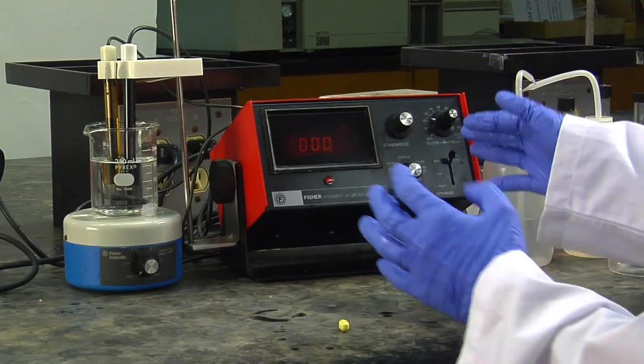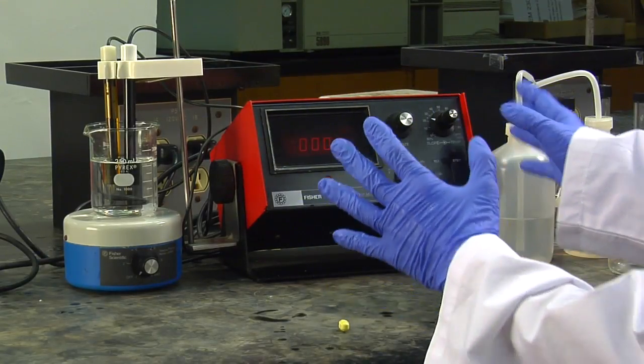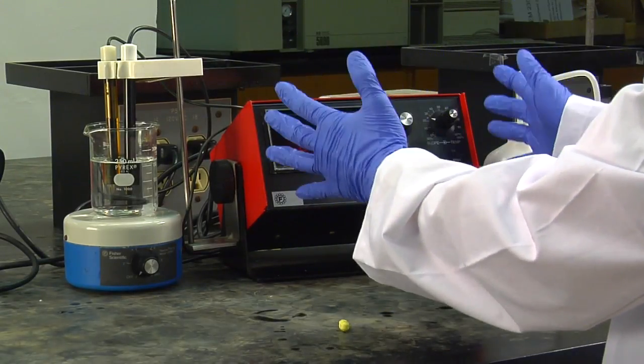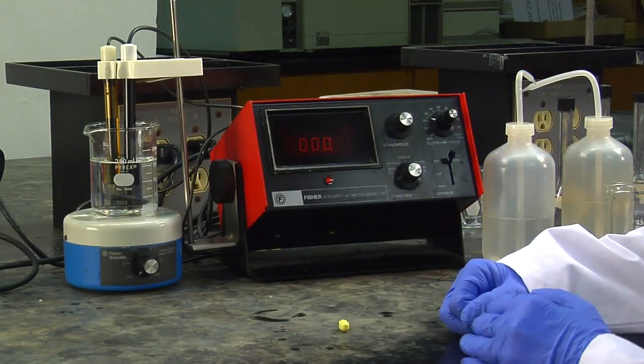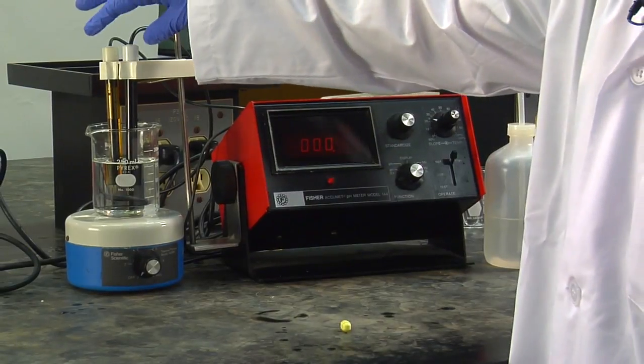So this is the unit right here. It's really broken up into two pieces. You've got the display unit, it's got all the controls, the screen where you can record your potential.